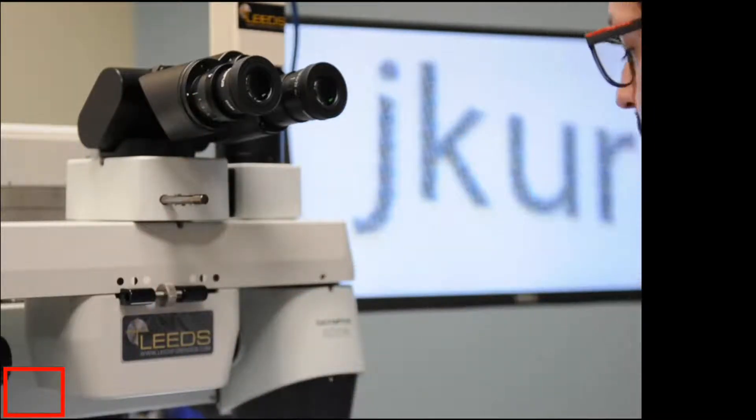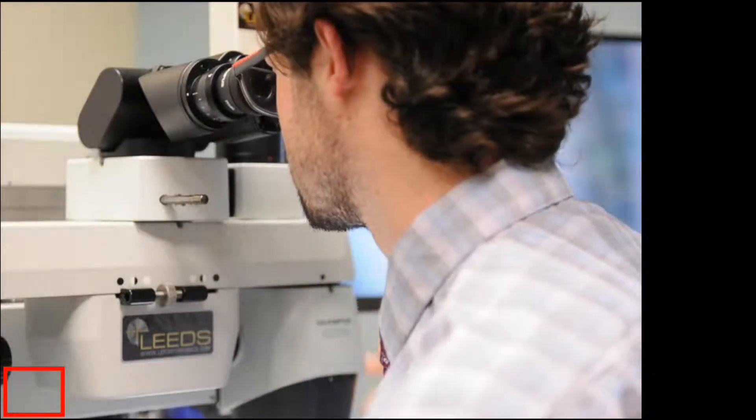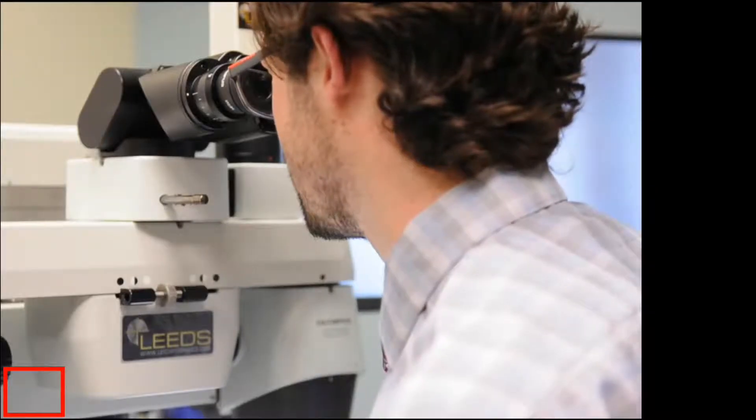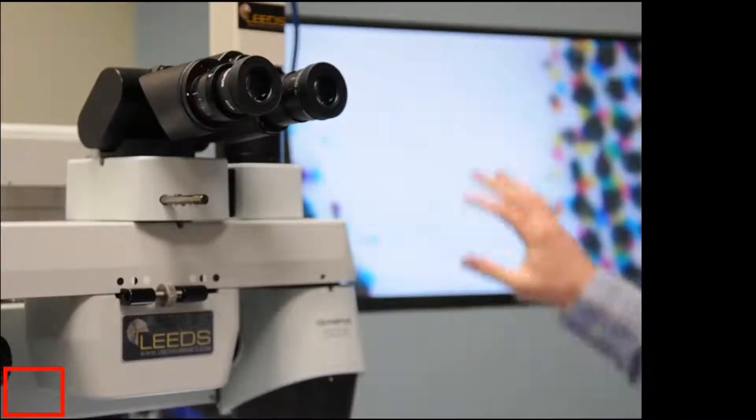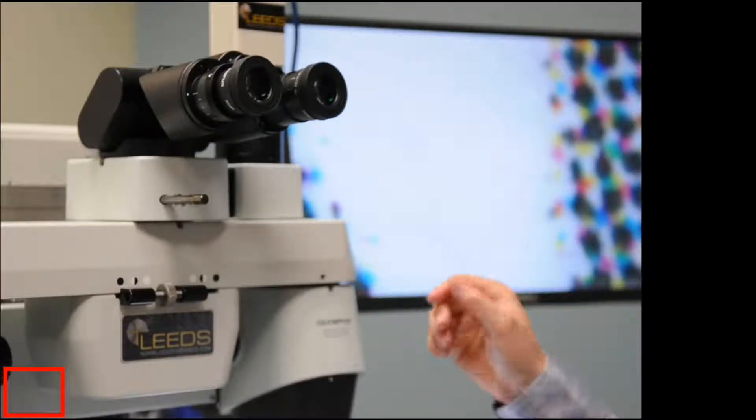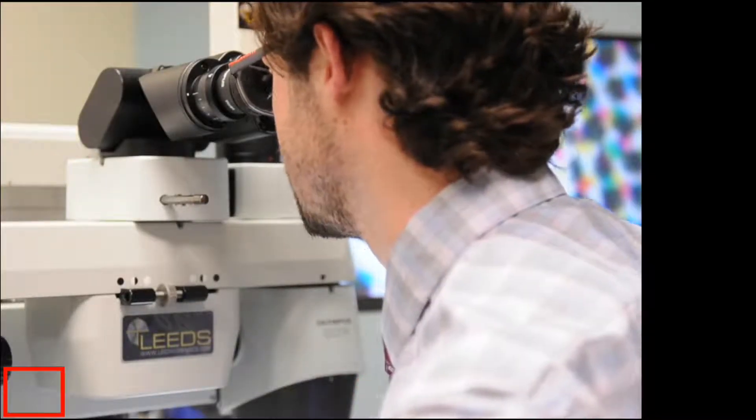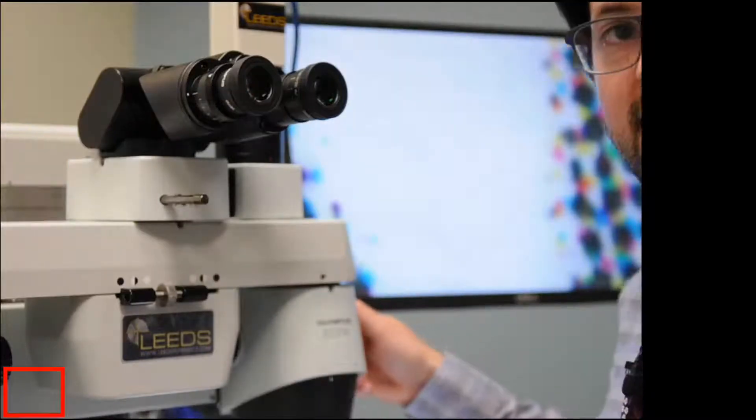My next step is looking through the microscope. I'm going to go ahead and zoom in to my maximum power, and you can kind of see on the monitor, what I've done is I've brought the image into focus so you can see those dots. And then what I'm going to do is make sure everything's in focus at high power, and now I'm going to go ahead and zoom out.